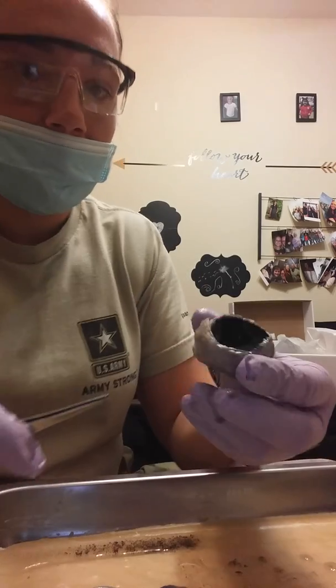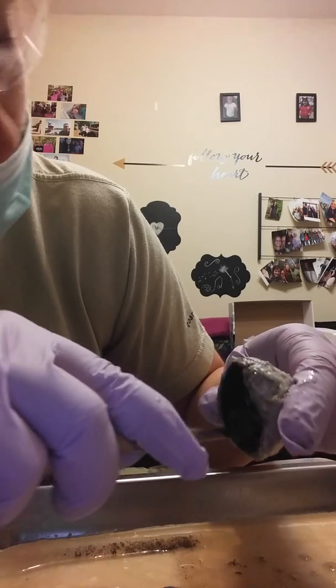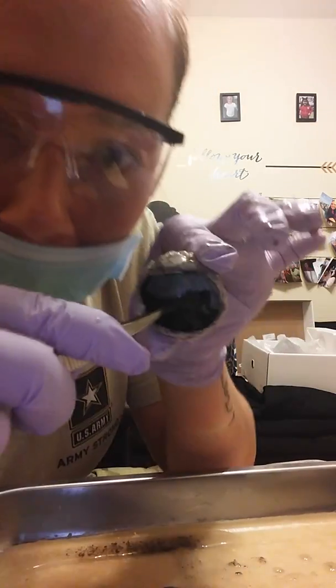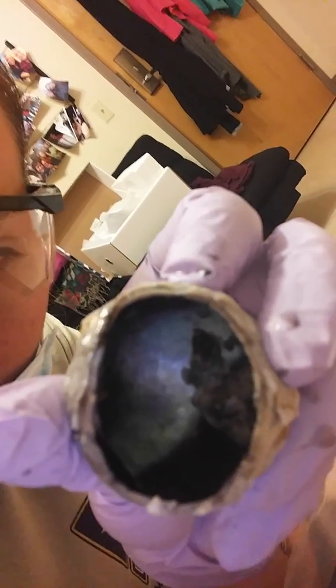And then in the back here we have this white material you see bunched up right here that would have been the retina. It would surround the entire backside of the eye. I don't know how well you can see that. So that white material bunched up right there would be the retina, and then the black, we don't have the metallic portion. That's a feature that cows have to see better at night, but the black portion in the back would be the choroid. Am I saying that right? The choroid. And then again, this thick white wall, you can see it a little bit better here. The thick wall on the outside perimeter of the eye is the sclera.